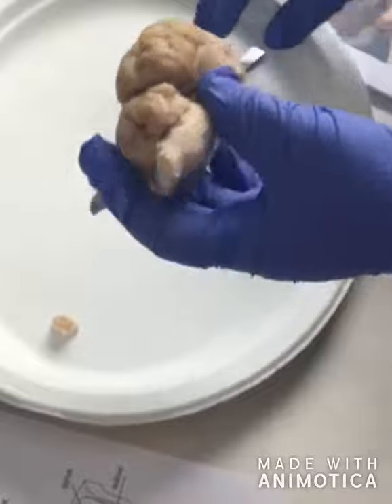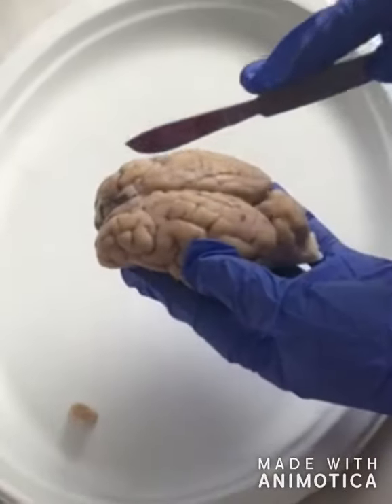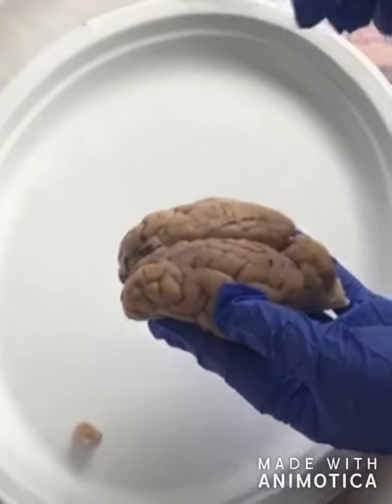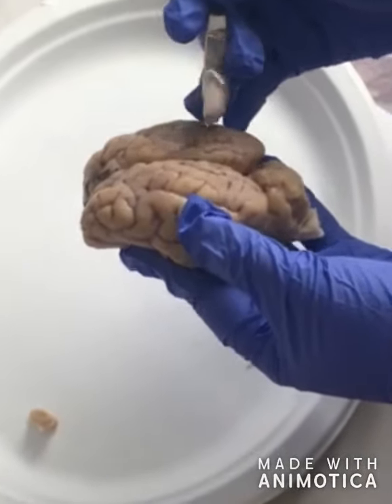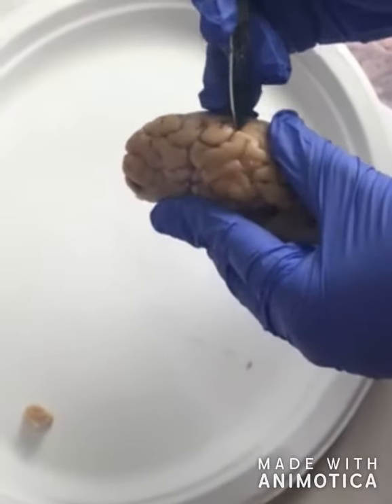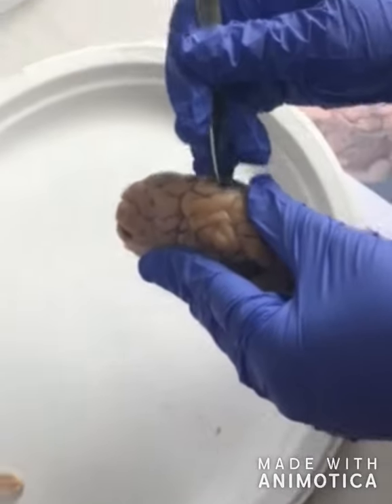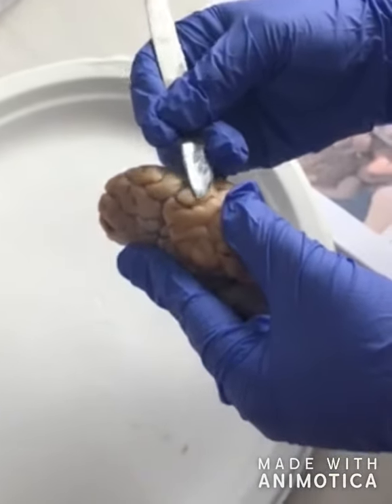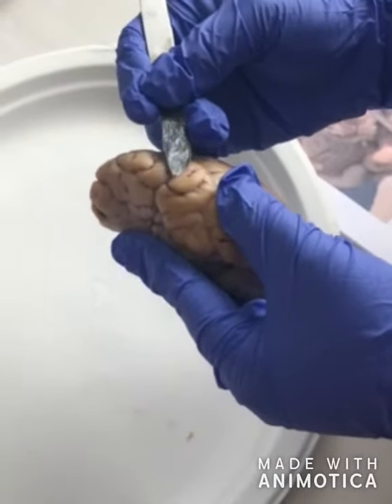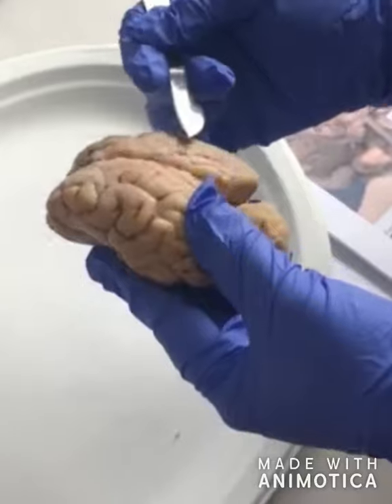So the cerebral cortex, we have 2 hemispheres: a right and a left hemisphere. And then we have the sulci, which are the grooves in the cerebral cortex. So these grooves in here are going to be the sulci, and then this part on the surface here is going to be the gyri, which are the folds or ridges on the cerebral cortex.